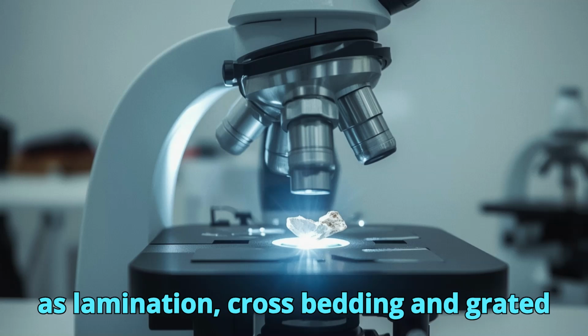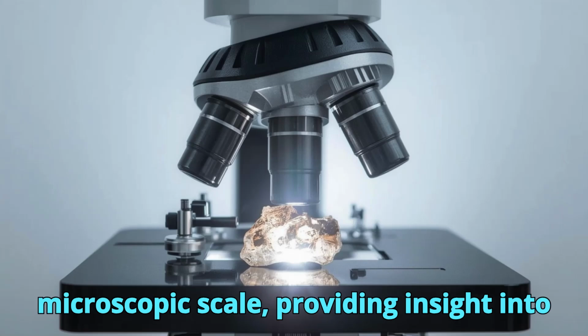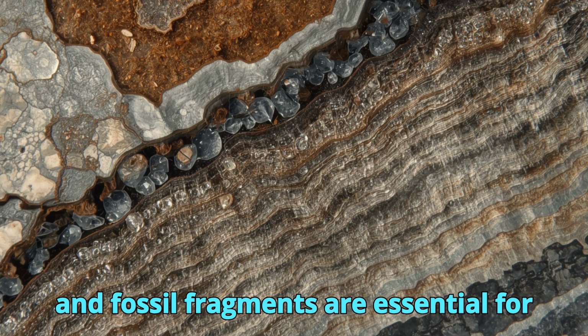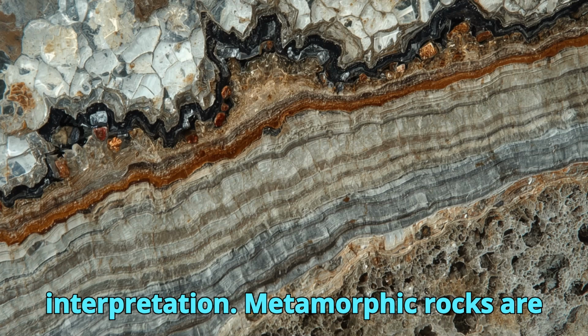Sedimentary structures such as lamination, cross-bedding, and graded bedding may be preserved at the microscopic scale, providing insight into depositional environments. In carbonate rocks, textures such as micrite, sparite, and fossil fragments are essential for classification and paleoenvironmental interpretation.